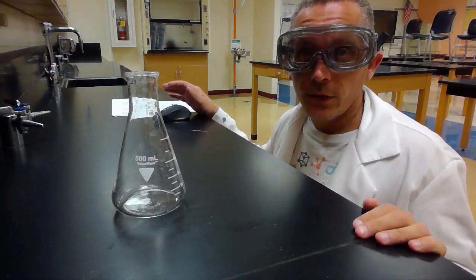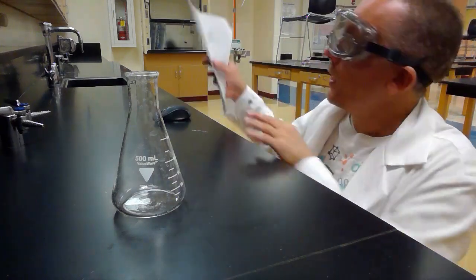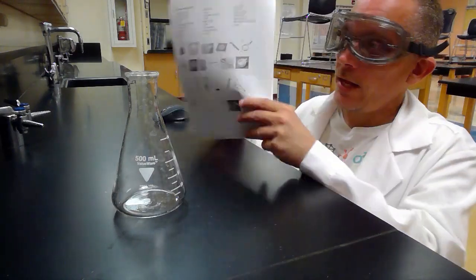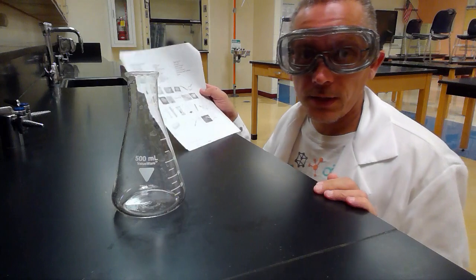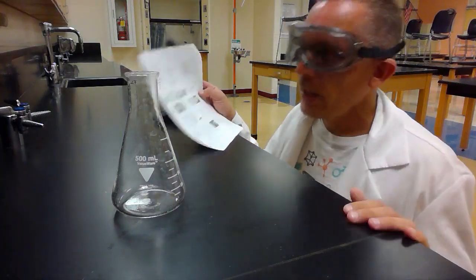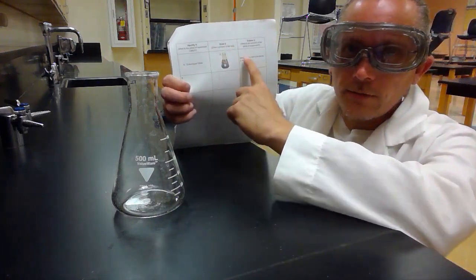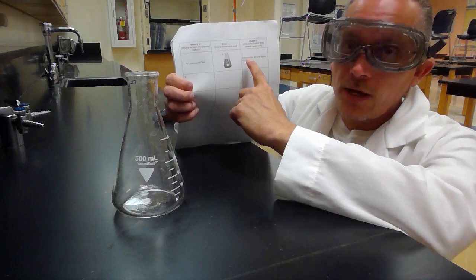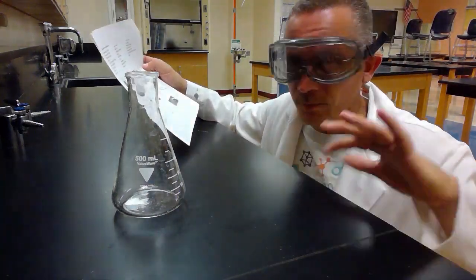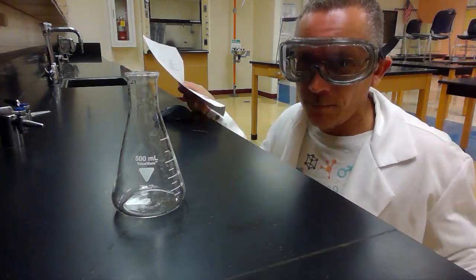Okay, let's take a look at some of the equipment on our assignment here. You should have your lab handout, and if you look on the second page of that, you can see there's all these pictures here. And what we're going to do is we're going to take a look at each one of these and talk about what is it called, what is it used for. And on your assignment, they want you to write its name, draw a little picture of it, and kind of describe what its use is. And we're not necessarily going to look at these in order because some of them go together. So we'll kind of look at the ones that go together at the same time.